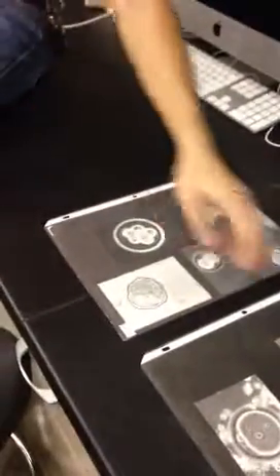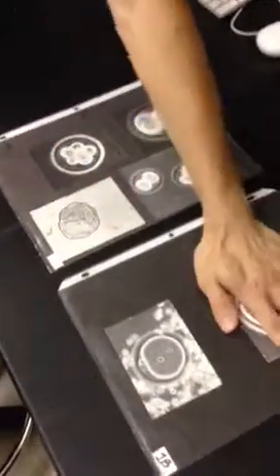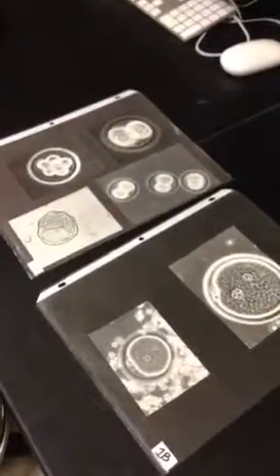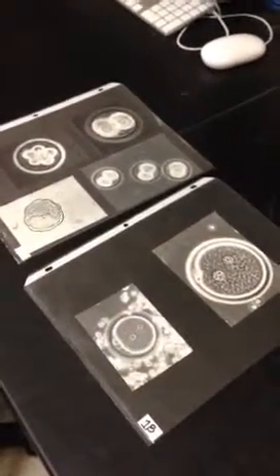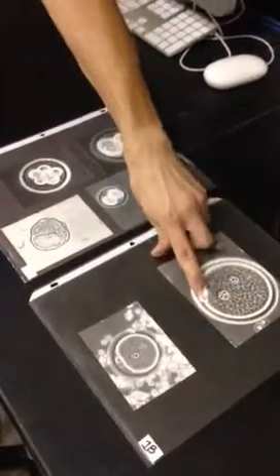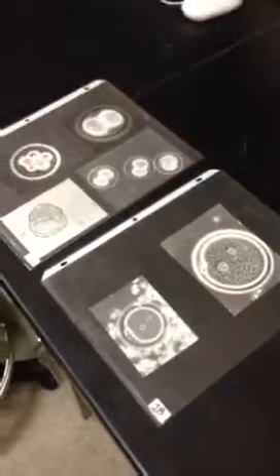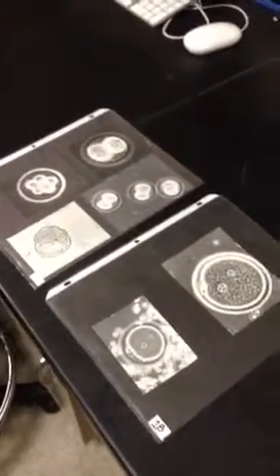So what's going on here? Cell division, yeah. Specifically of what though? Usually cells when they divide don't have two totally separate nuclei. No, no, just mommy nucleus, daddy nucleus, right? So this is a zygote right after fertilization. So these are the maternal and paternal pronuclei. It's your polar body. So if you had to order these, all this is cellular development of an embryo. Just put them in order from first to last.